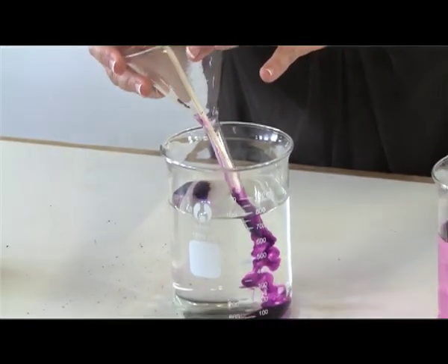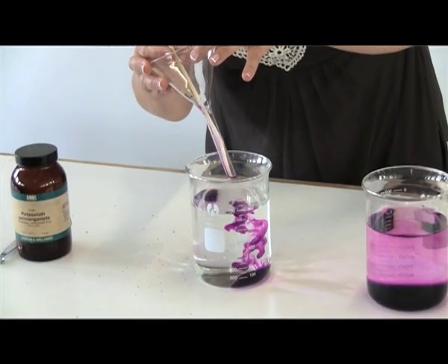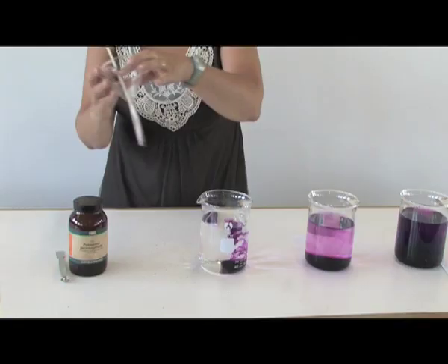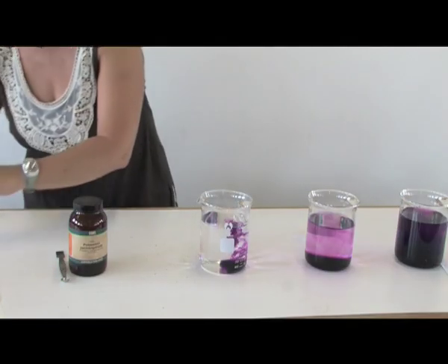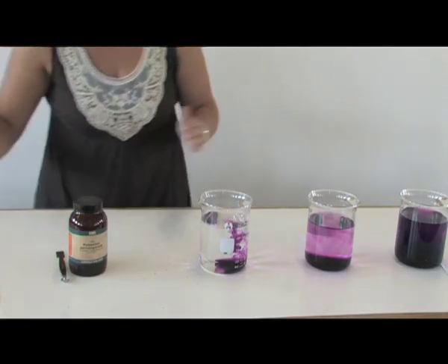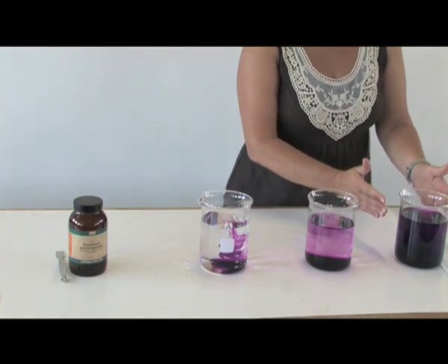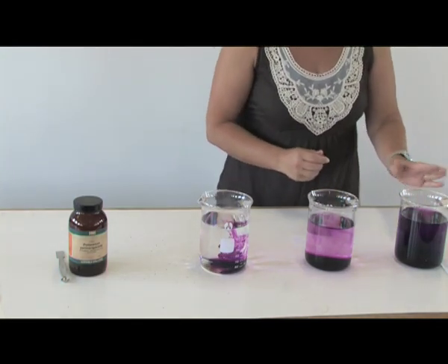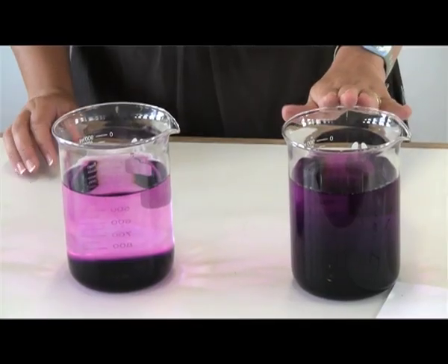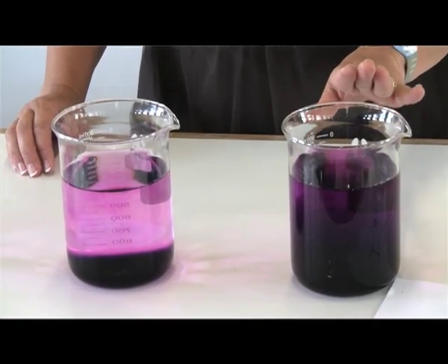You can immediately see that there is a spontaneous movement of these potassium permanganate crystals. I slowly take out the funnel and you can see that the movement is occurring.